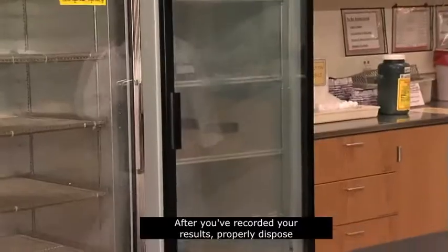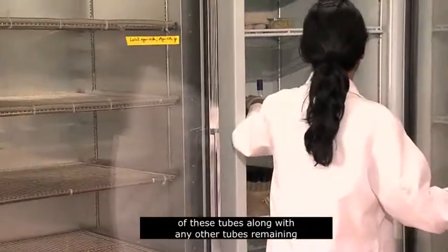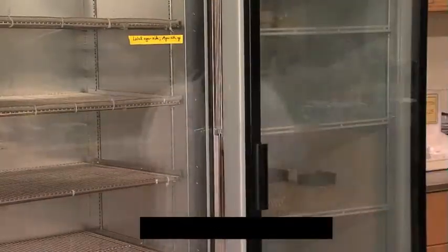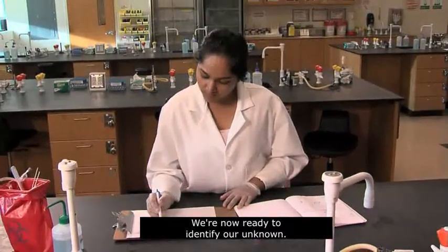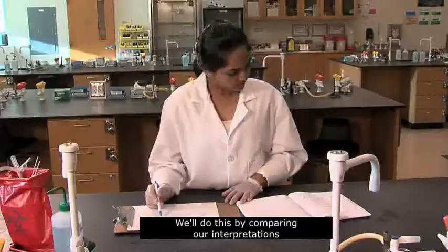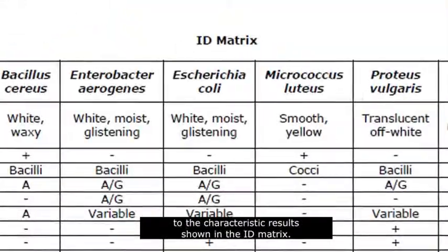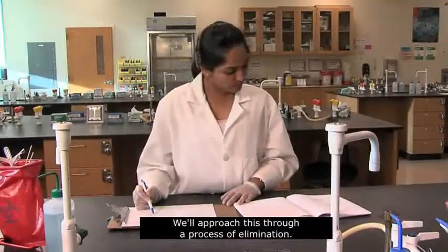After you've recorded your results, properly dispose of these tubes along with any other tubes remaining from this lab. We're now ready to identify our unknown. We'll do this by comparing our interpretations in the results table to the characteristic results shown in the ID matrix. We'll approach this through a process of elimination.